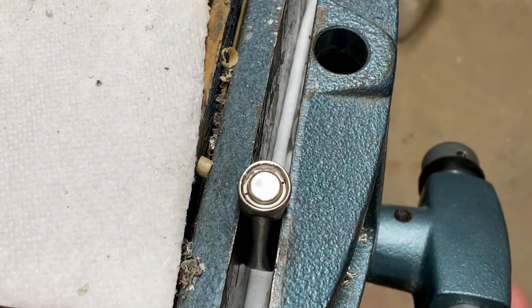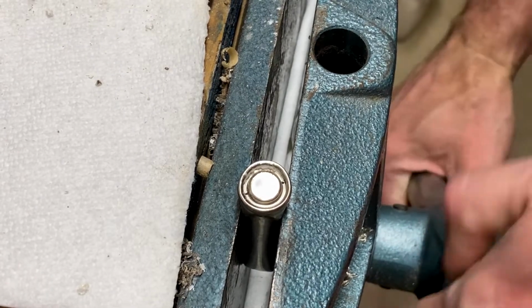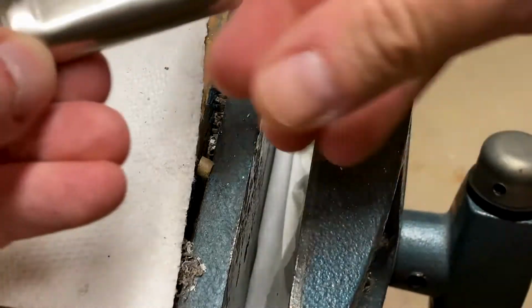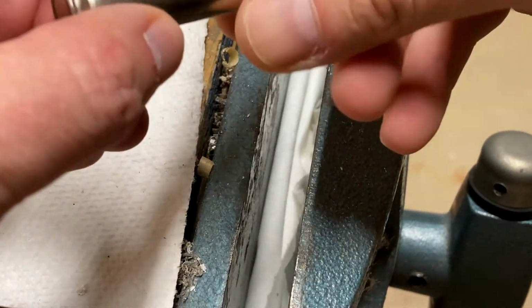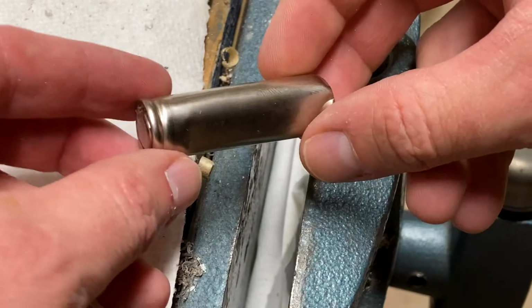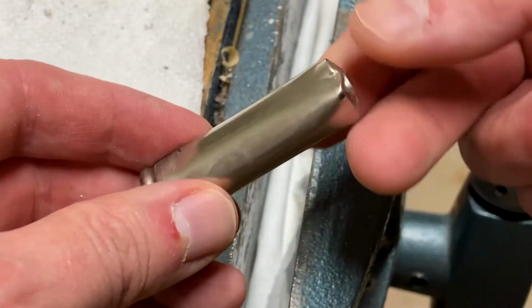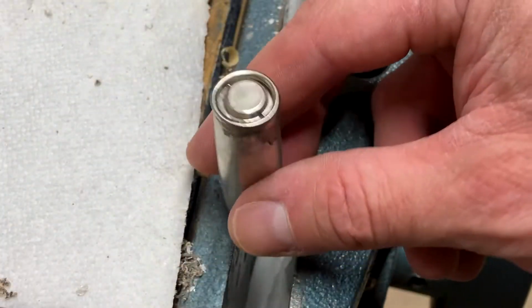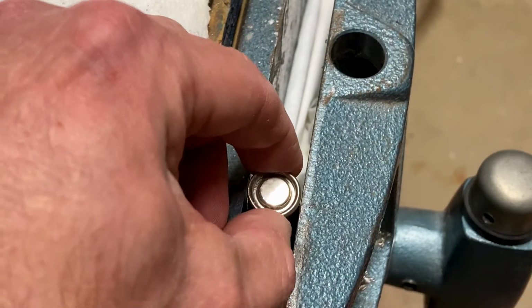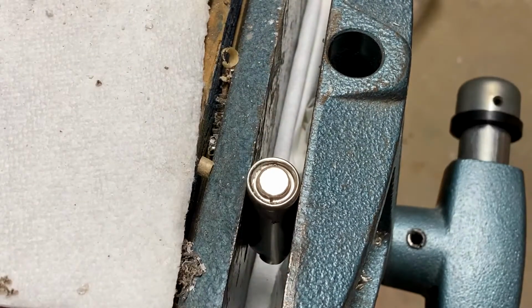It seems a little more compliant, but not by much. All right, maybe this really is not going to work the way I was thinking it was. I was hoping it would. But it doesn't look like it. Might want to take the hammer to it or something. Just trying to see if I could do this in a way that wouldn't be so messy. But let's see. Give it one more try the other way.